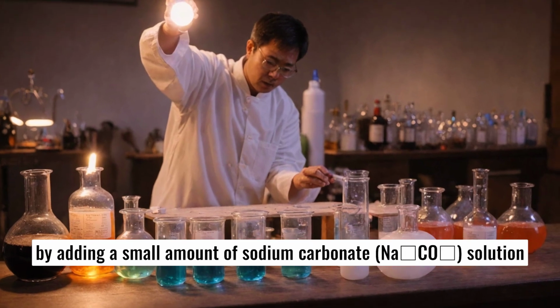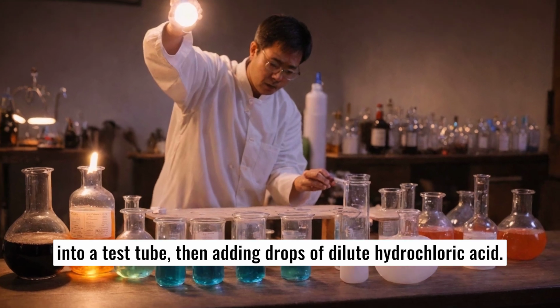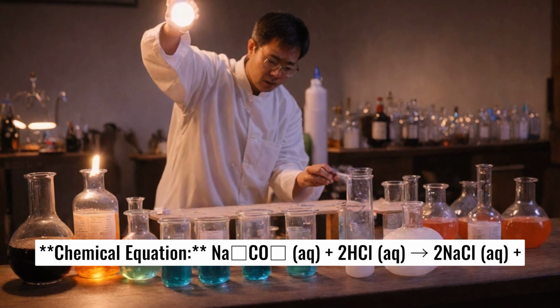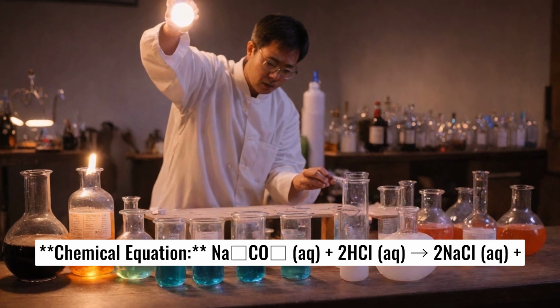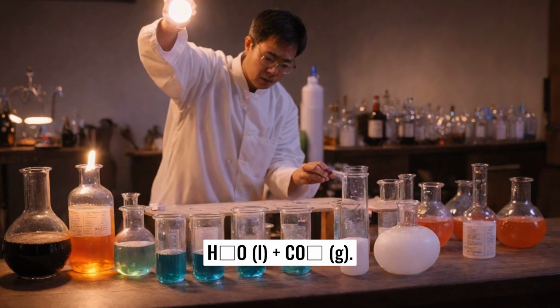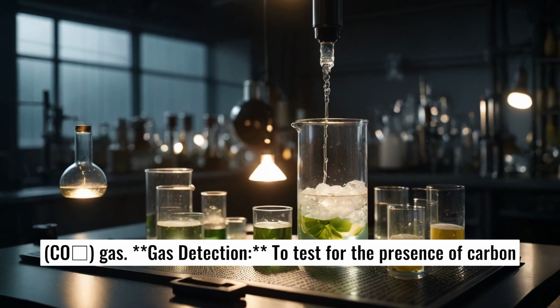We begin by adding a small amount of sodium carbonate, Na2CO3, solution into a test tube, then adding drops of dilute hydrochloric acid. Chemical equation: Na2CO3(aq) + 2HCl(aq) → 2NaCl(aq) + H2O(l) + CO2(g). We will notice rapid fizzing due to the formation of carbon dioxide, CO2 gas.